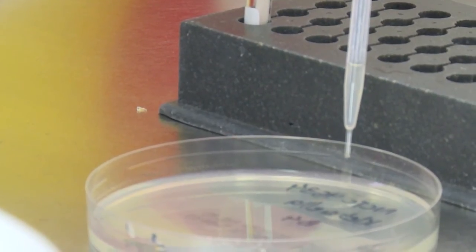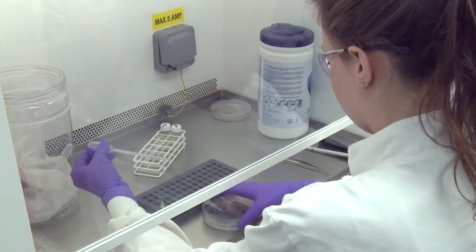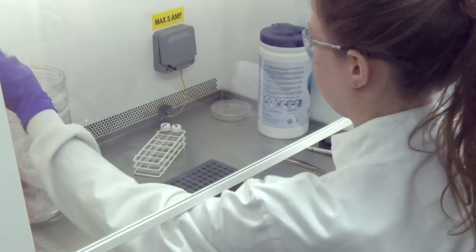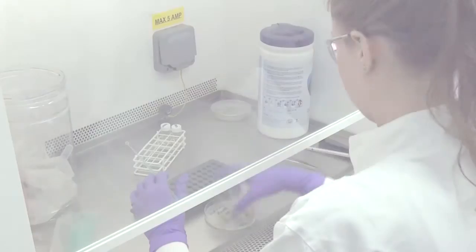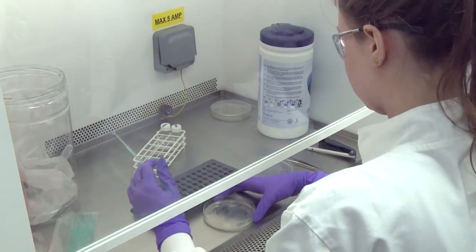According to the gaseous and growth requirements, the broth suspension should be subcultured onto a suitable medium or media, preferably chosen to include a solid medium.